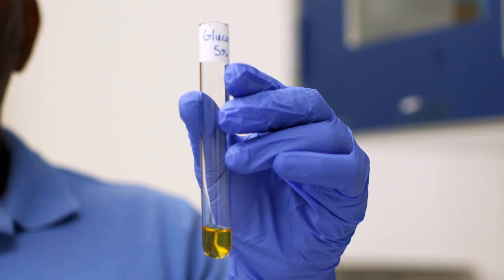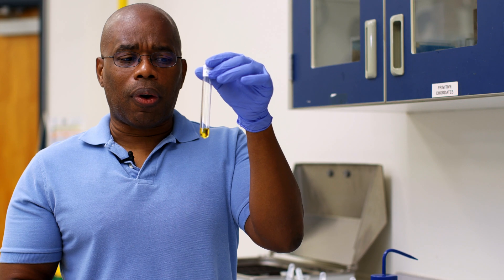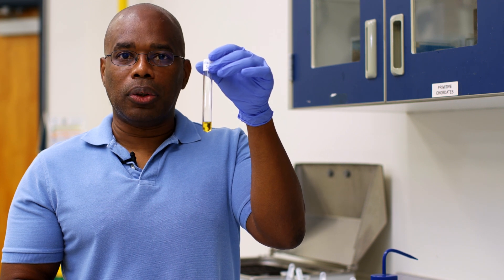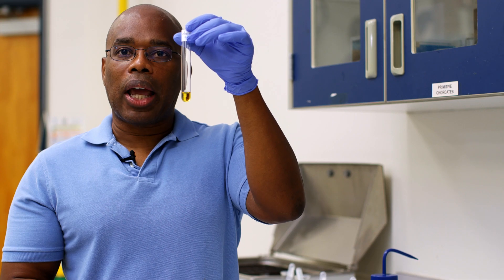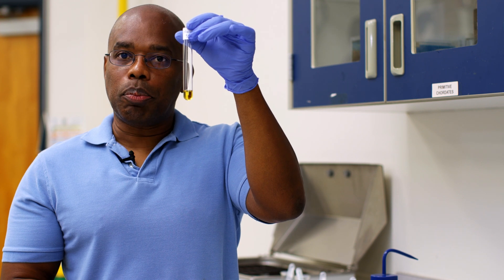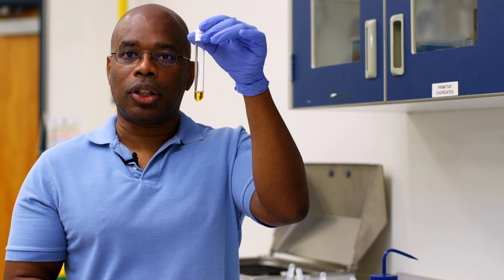The next solution we're going to look at is glucose. From our previous test, you should have figured out that glucose is a reducing sugar. Therefore, it should not turn a dark color when we add Lugol's. Although you see a color change from the clear glucose solution, remember that we're looking for a dark color change — this simply shows the color of the Lugol's as we're adding a colored solution to a clear solution.